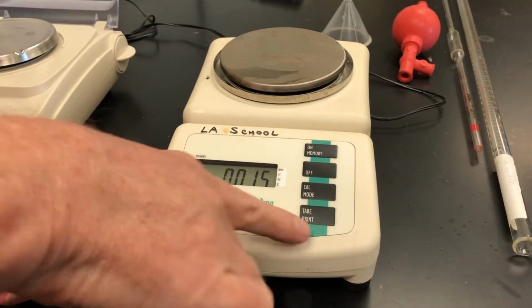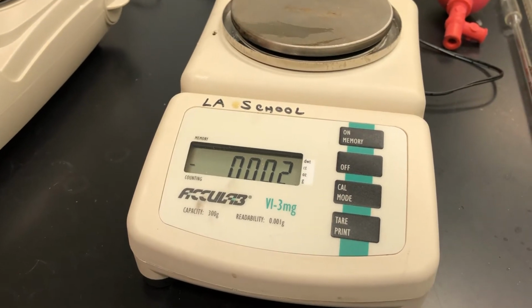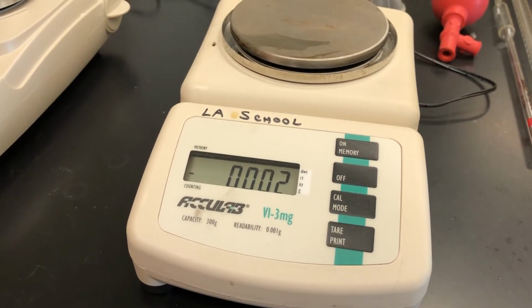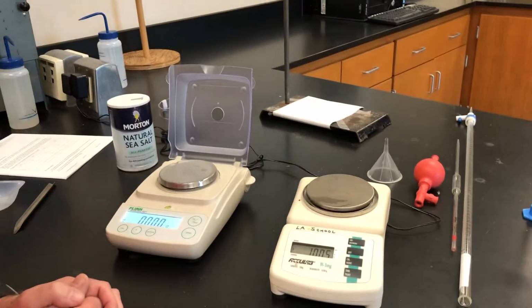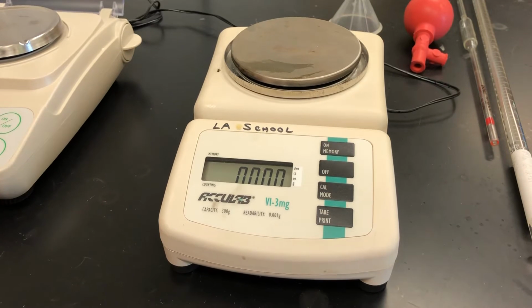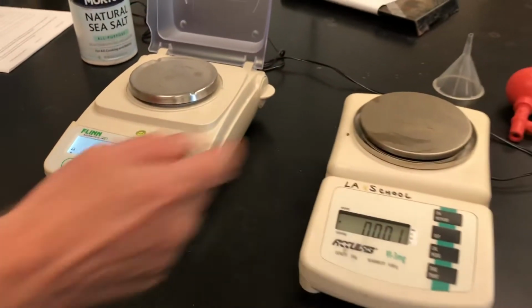So what I'm going to do is press the tare button here, and that's going to set it to 0. And you can see that it may not read exactly 0, and so I try not to chase the rabbit in terms of trying to make it read 0 in the last decimal place. The other thing to consider is that if there's any kind of air currents, it will cause some fluctuations in the balance. So the fact that we have 3 decimal places, that's actually quite a few decimal places, and that's why I typically don't chase that last decimal place there.